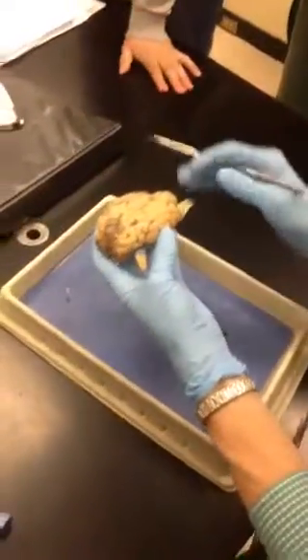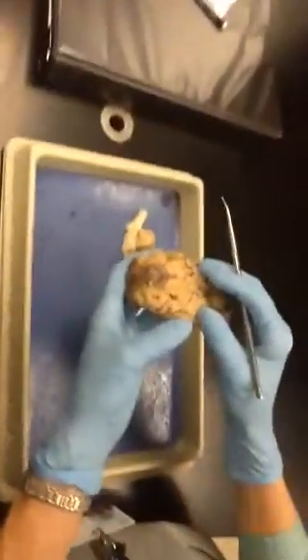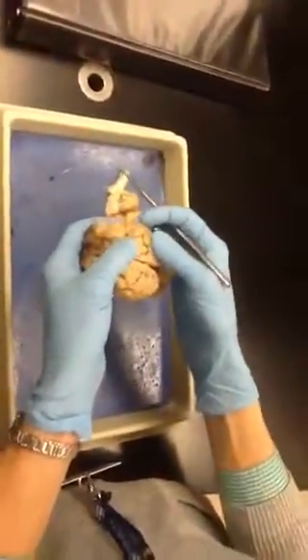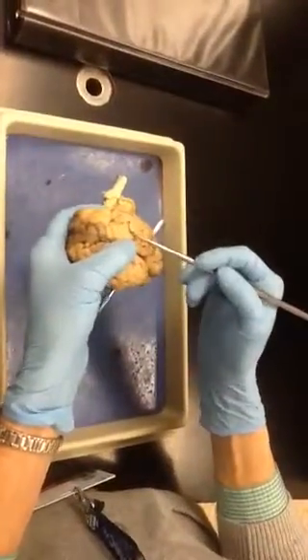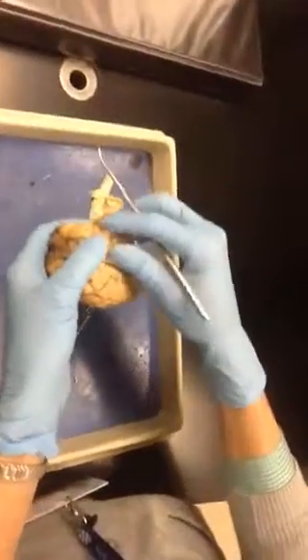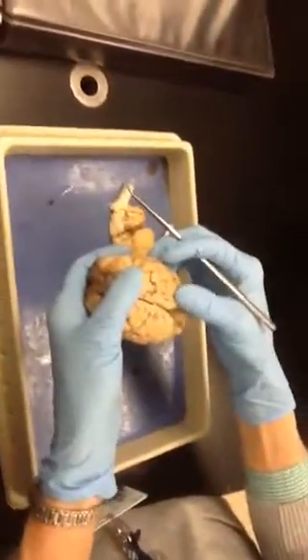on the brain. The one that's directly on the brain tissue is called the pia mater, and the pia mater is what holds all of these, the gyri and the sulci. The gyri are the bumps, the sulci are the grooves. So the pia mater is what actually holds all that stuff together, so it doesn't all flop apart.